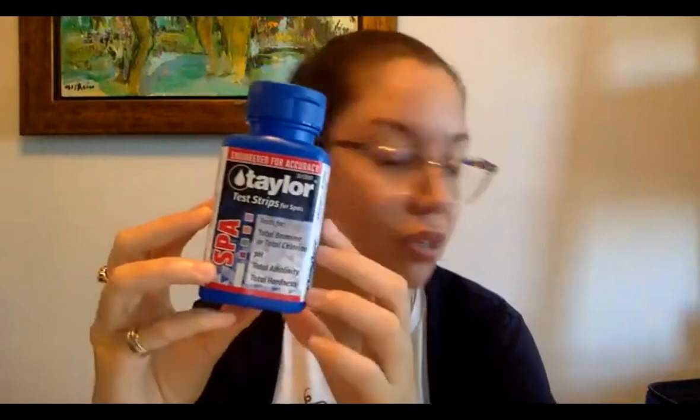The second thing you'll find in your kit is going to be these little test strips. So these are actually pool test strips, but we've done a lot of tests with different test strips to see which ones are more accurate and which ones have a good range for rivers and lakes, and these ones were the best. I'm just gonna take another bottle because this one's missing info. And in the back, there's a little scale with all of the different meaning for the different parameters.